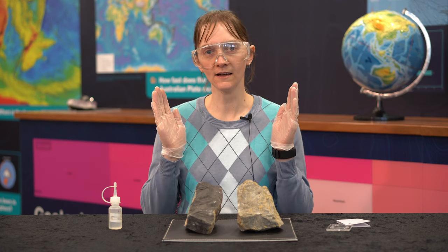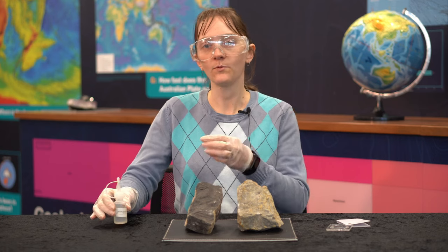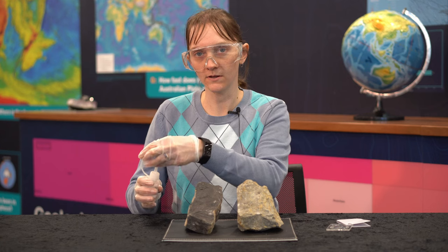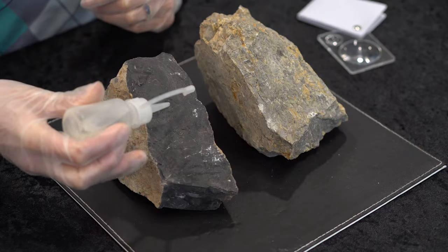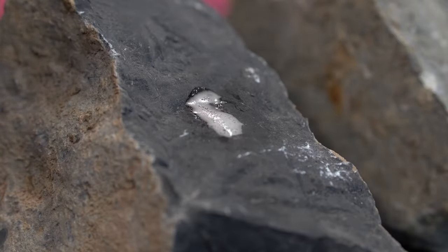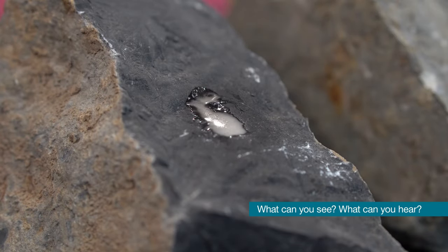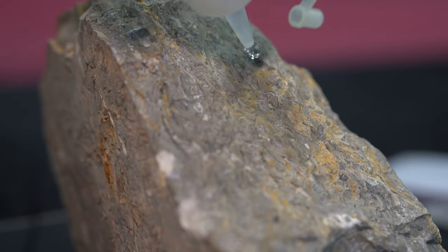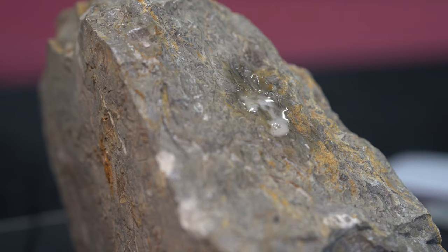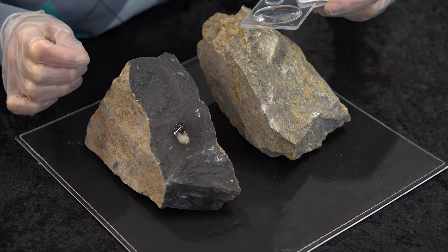Put on your safety gear, line up your specimens, then put one drop of hydrochloric acid on each specimen and watch closely. You might even like to have your hand lens ready to watch for a reaction.